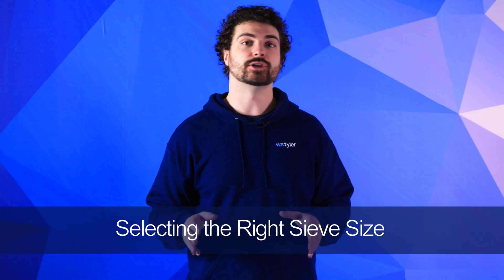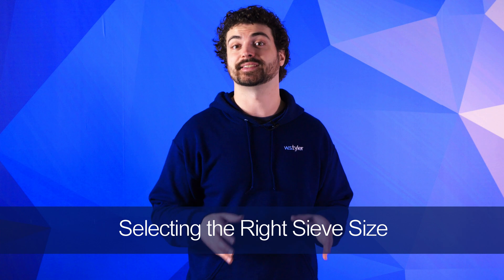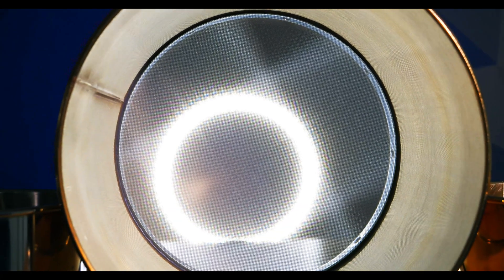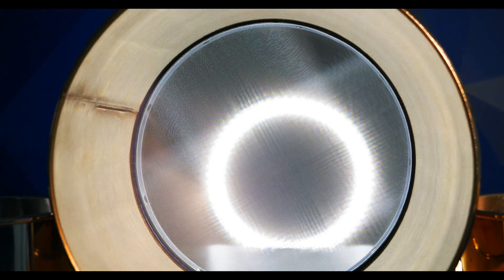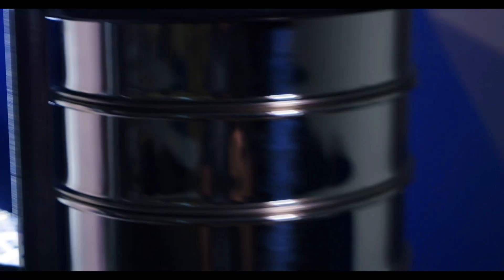You'll also want to make sure you choose a sieve size that'll best fit the sample size you're running. Selecting a sieve size that's too large will result in unwanted particles making their way through the mesh openings. On the other hand, selecting a sieve size that's too small may prevent desired particles from passing through, causing them to accumulate in the openings and hinder the result of the test.